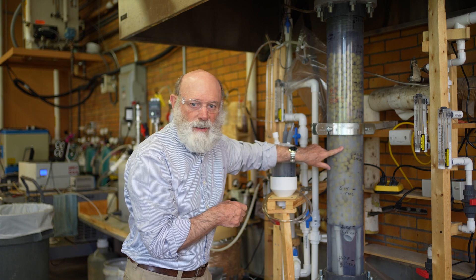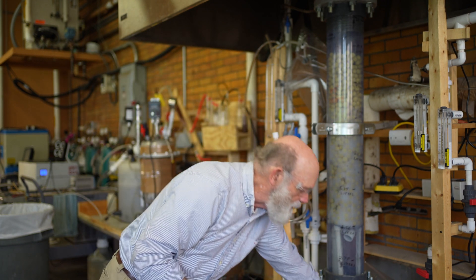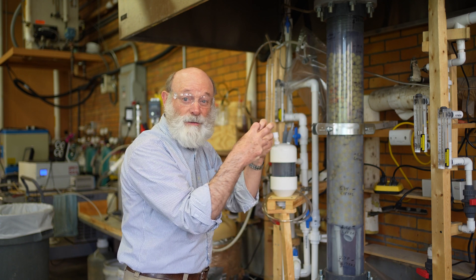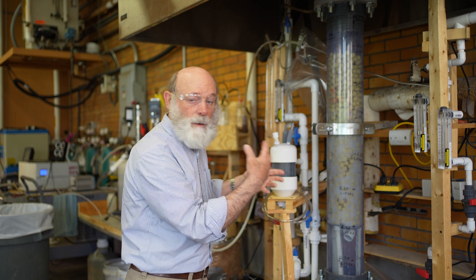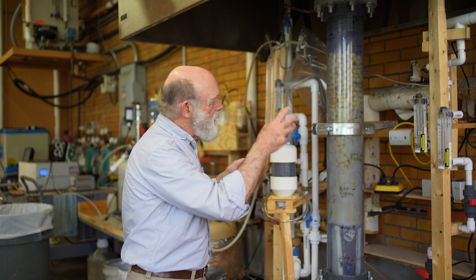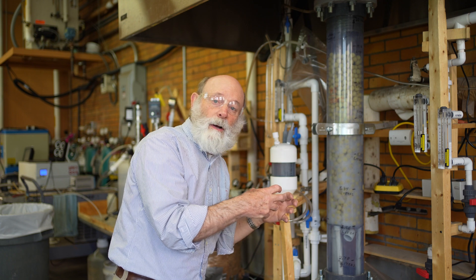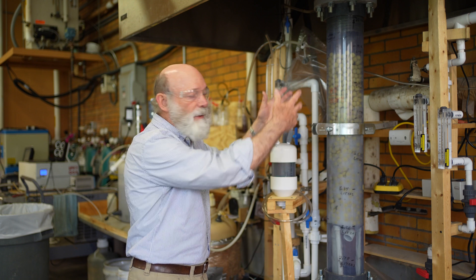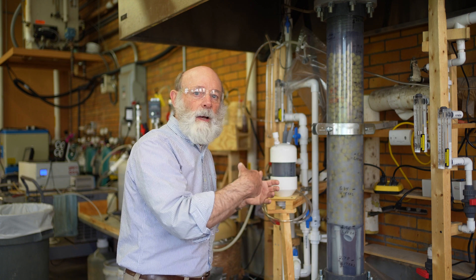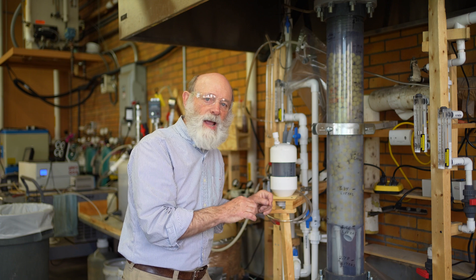What we have in the column now is a different type of packing — as I mentioned, we previously used pall rings. We've now tried some clay balls that have some porosity to them. Our plan is to see if the anaerobic bacteria tend to grow onto the clay balls so we can increase the amount of bacteria growing in the column and increase the chemical kinetics of converting the hydrogen and carbon monoxide to acetic acid.